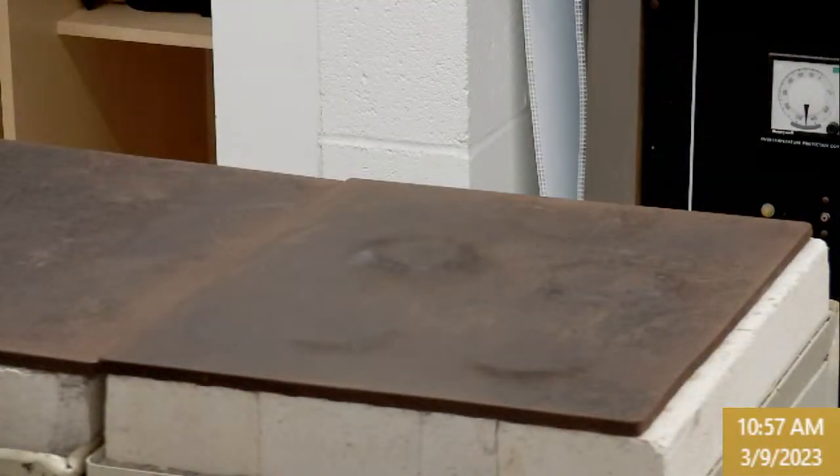So for flux, are we supposed to put down the amount we put in, or just which type it is? For which question? For the flux, the table. Flux identity is a sodium flux, so sodium carbonate in particular. The weights are recorded here. That's back to when we were changing up fluxes, but those created so many different problems. We just settled on sodium and just talk about the other.